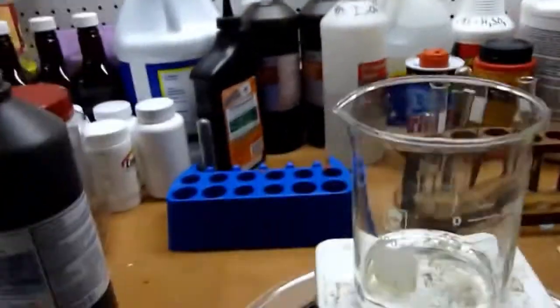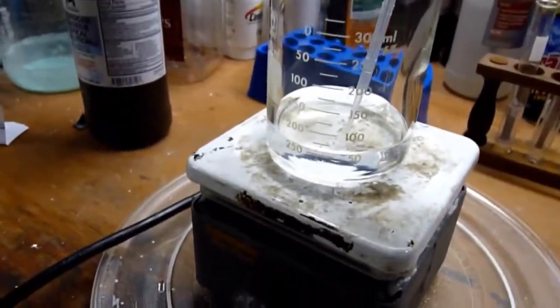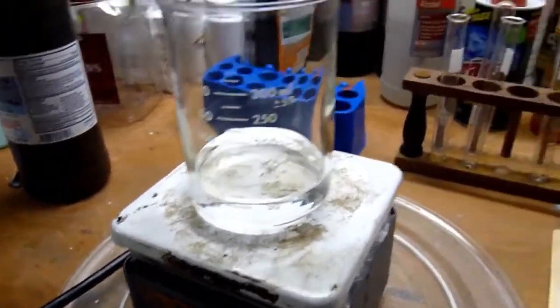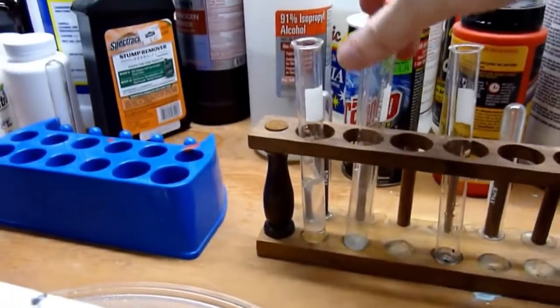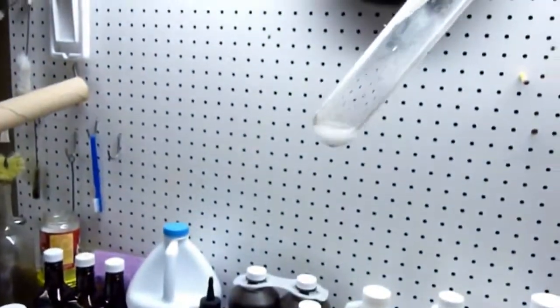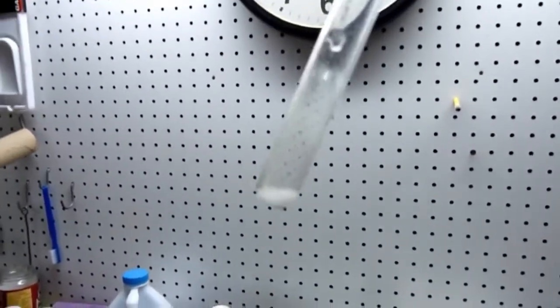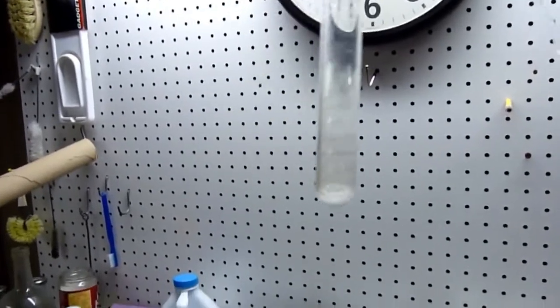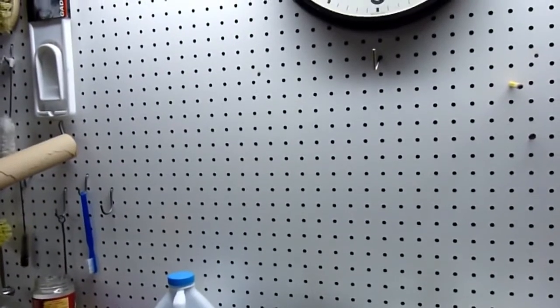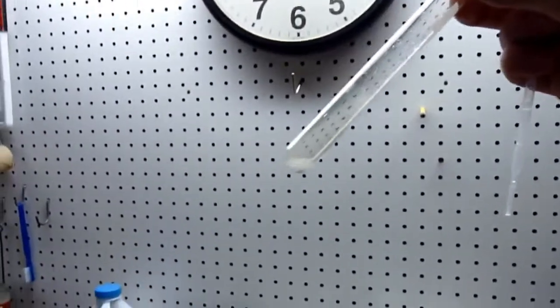And now let's try some of our 15%. I'm not going to use a lot of it because I need this for something else, but as you can see the reaction is far more vigorous. And you can actually hear it. I'll put this up to the camera's microphone. And you're bubbling out of there. So there. That was the concentration of hydrogen peroxide.